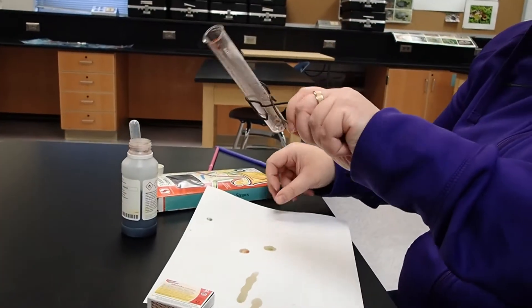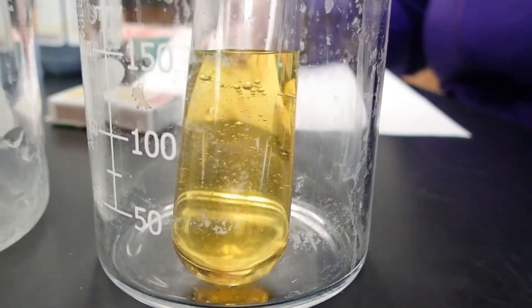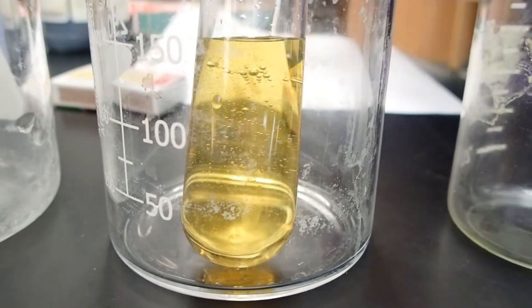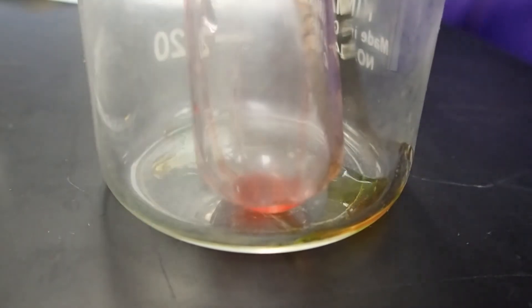So let's compare all three of our situations. We had our surface tap water, our naturally acidic rainwater, and now with our match, simulating our acid rain.